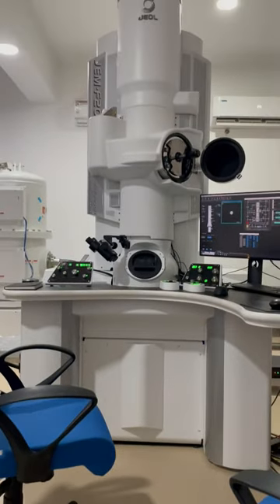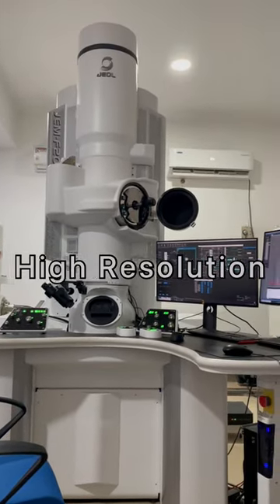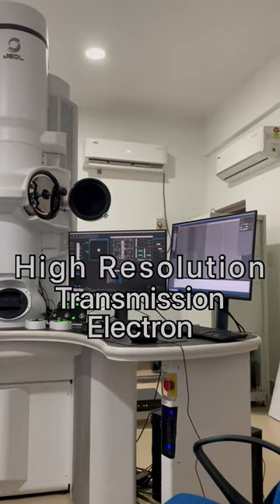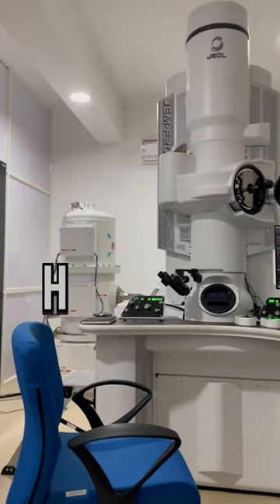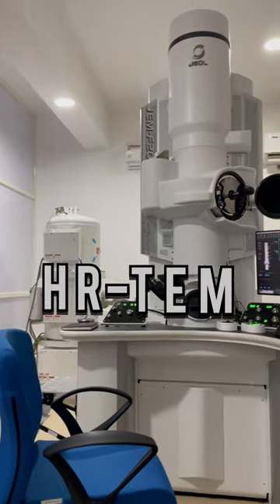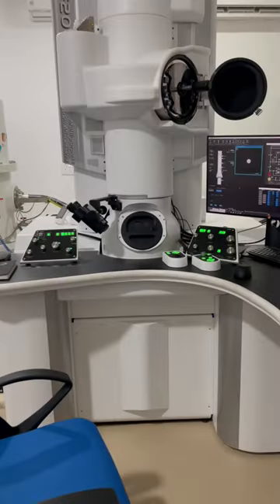This particular instrument is a high resolution transmission electron microscope, also called HRTEM. There are certain features of it.